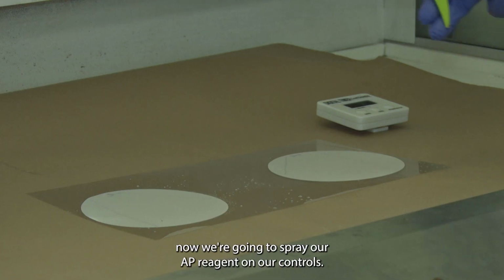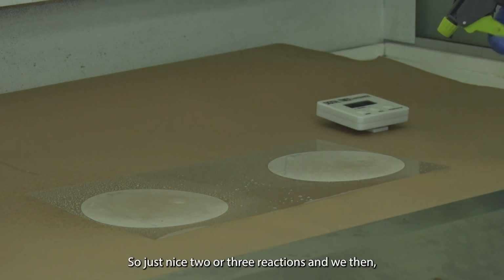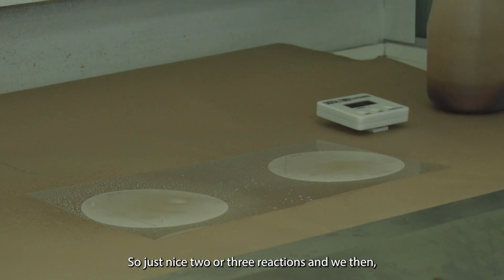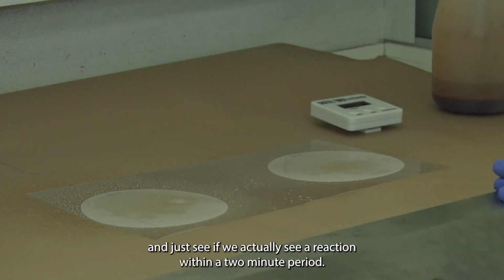Now we're going to spray our AP reagent on our controls, just 2 or 3 sprays, and we then set our timer for 2 minutes, and sit back and see if we actually see a reaction within the 2-minute period.